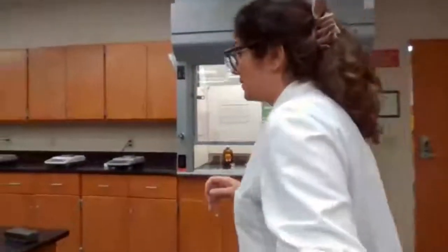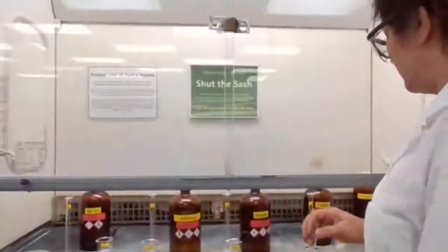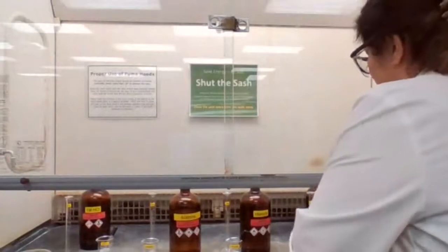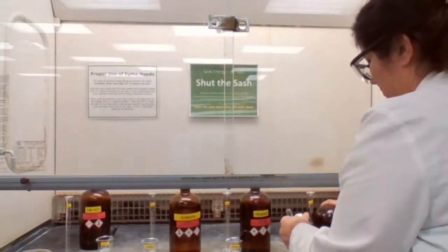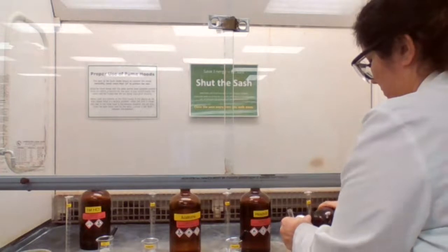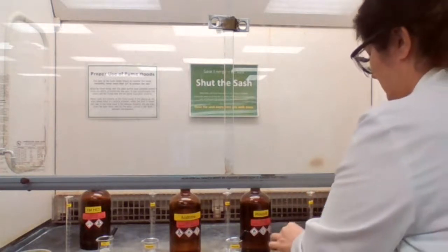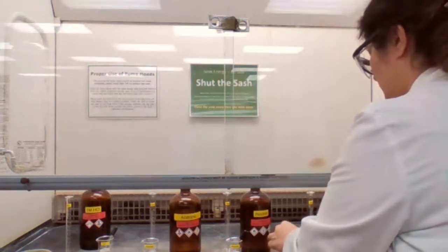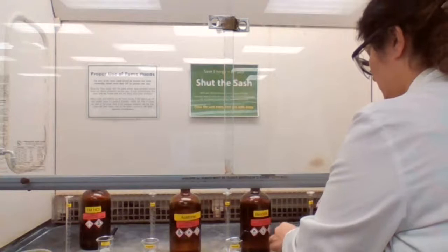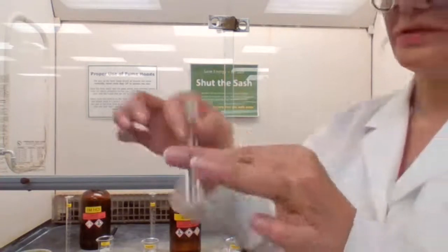Take you around the lab so you get to know the lab even though you're not here. Okay, this is naphthalene in water.